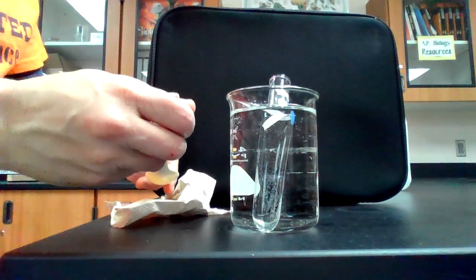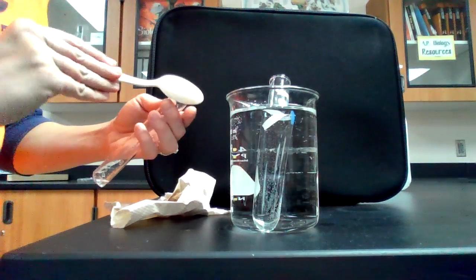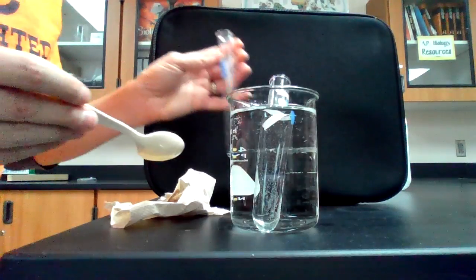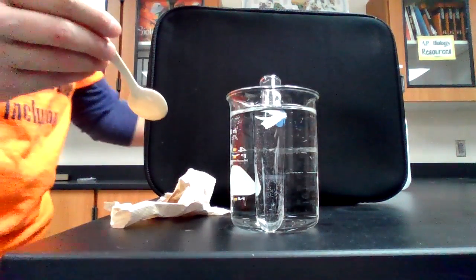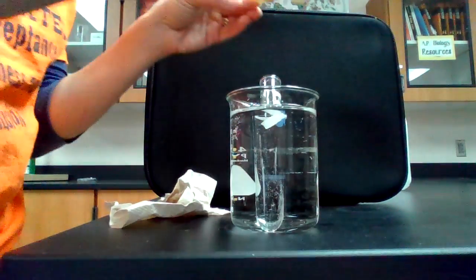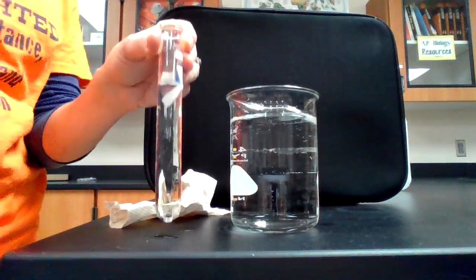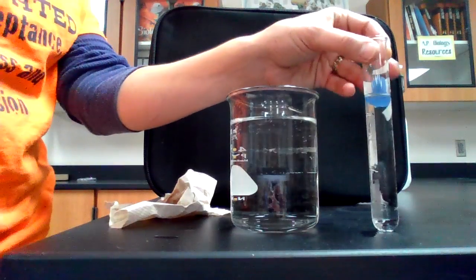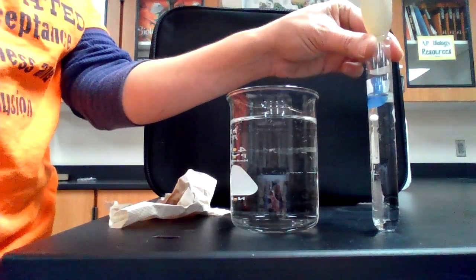Hang on, trying to just get one of these little spheres for you, but they all want to come out at the same time. Oh, this is not working well at all. All right, luckily, since this trial is supposed to be at room temperature anyway, it's okay if they sit at room temperature for a minute. So I will take this out. Hopefully you can see this a little bit better this time. I'll put it on that side. This is trial number 2 at room temperature. Ready, set, go.